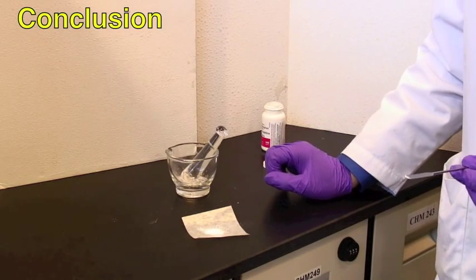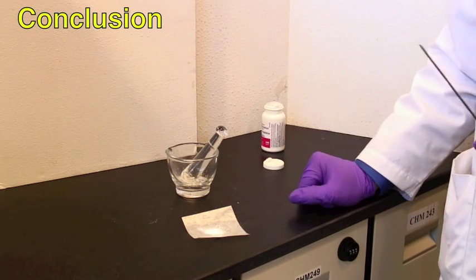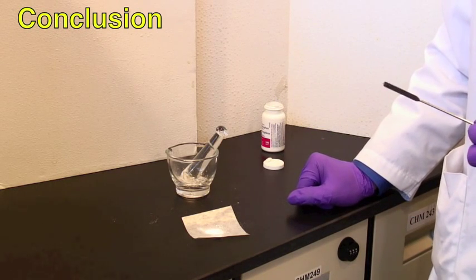You should now know how to grind properly with a mortar and pestle without sending solid particles flying across the lab.